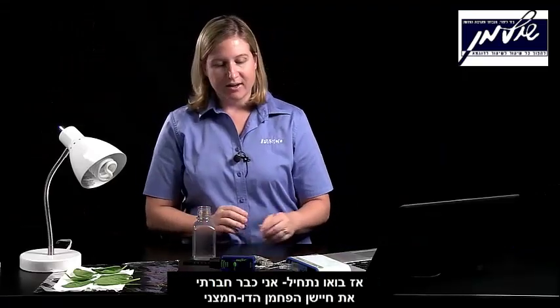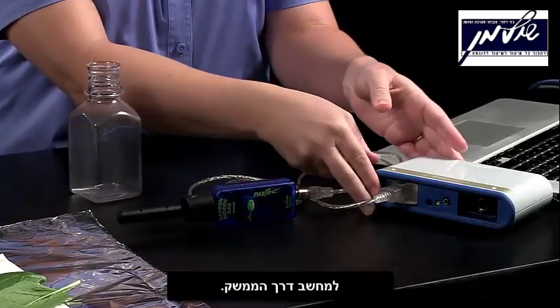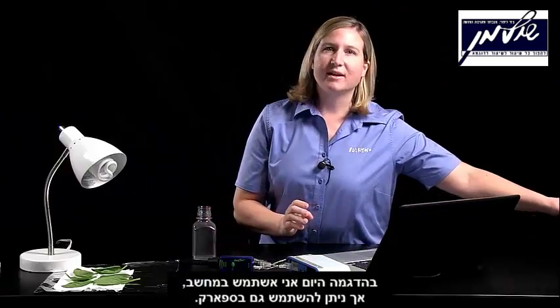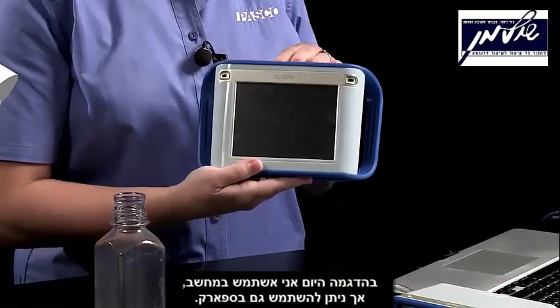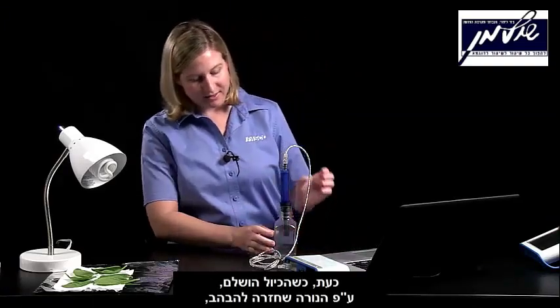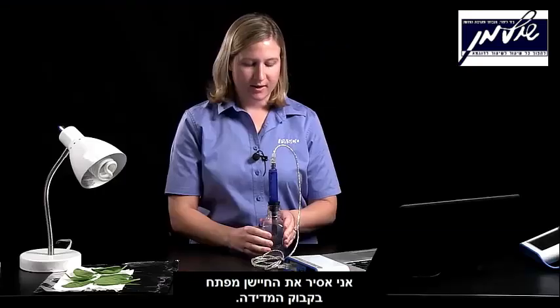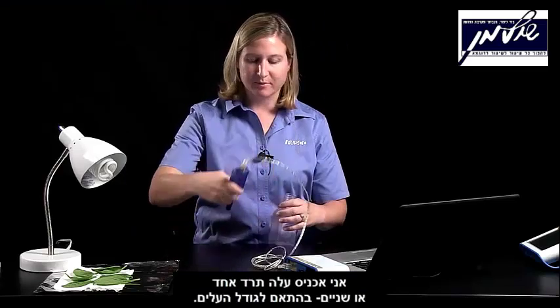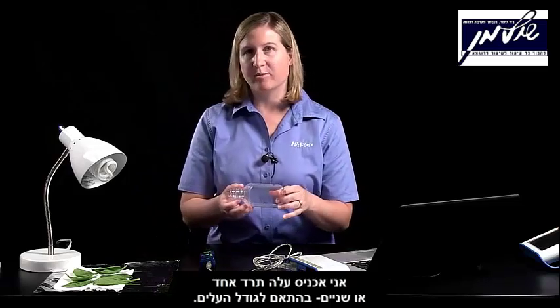To get started, I already connected my carbon dioxide sensor to my computer via the SparkLink. I'll be using a computer for today's demonstration, but the lab could just as easily be done on the SparkScience learning system. Now that the calibration is complete — which I know from the light beginning to blink again — I'm going to remove the carbon dioxide sensor from my sampling bottle and place one or two spinach leaves into the bottle.